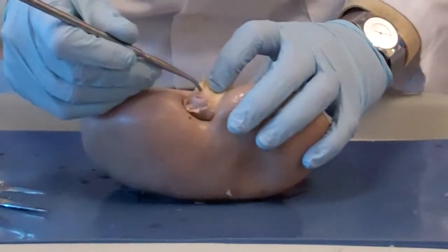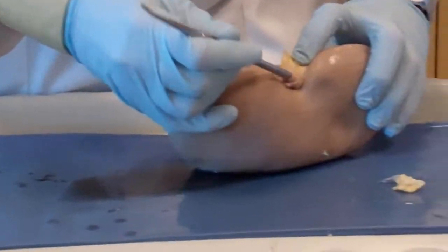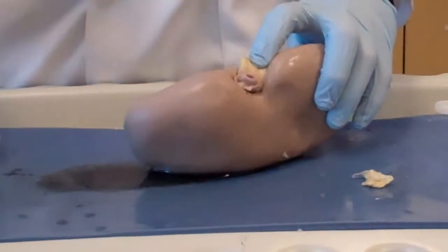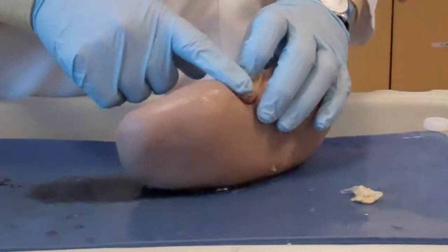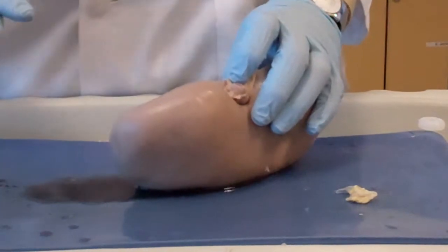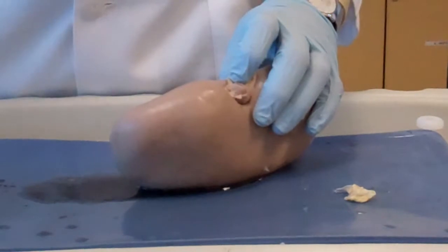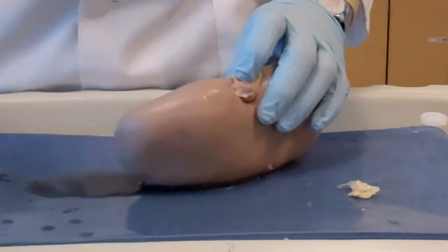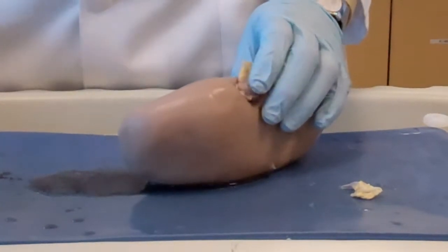So we see the ureter here, which is very clear because it is a muscular organ, okay? And remember, muscular organs always retain their shape, because as soon as the urine hits the first part of the ureter, boom, boom, boom, peristaltic movements, they send the urine, and from there, the urine is milked towards the urinary bladder, okay?